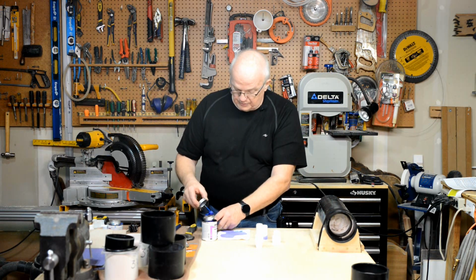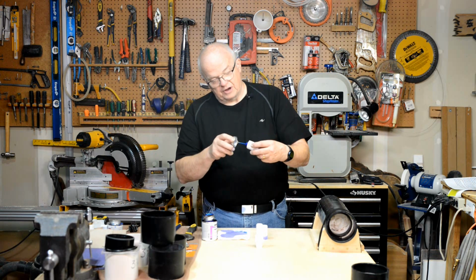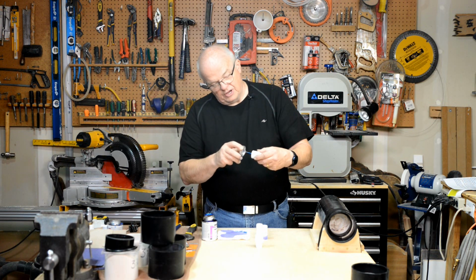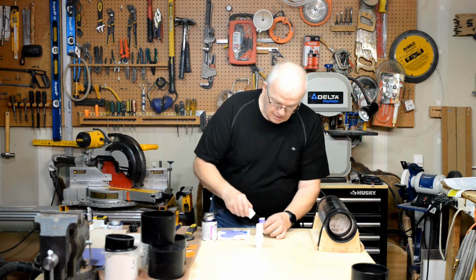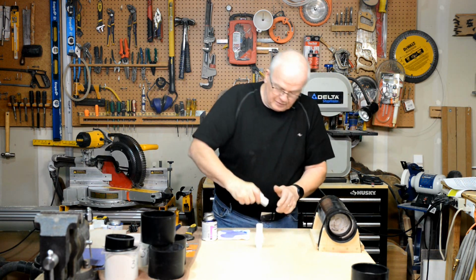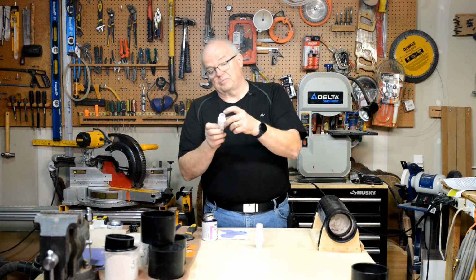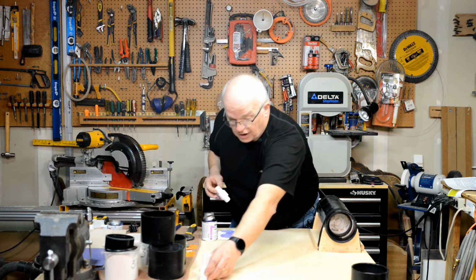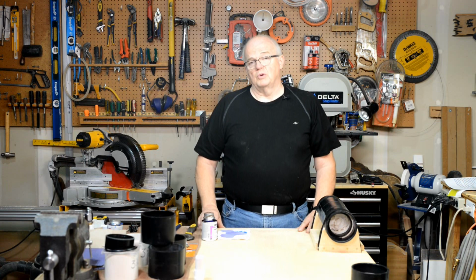So let's go ahead and do the other one. Remember, be very careful. Put your glue on the inside only. Make sure you get a fairly liberal amount inside of there. Take this and push it all the way on. And again, that's a nice clean edge there. But if you look on the inside, you'll see plenty of squeeze out. That's why we only put it on the inside of the adapter. Now we set those aside. All right, so go ahead and pause it here. Get up to that point and come on back and we'll move on.